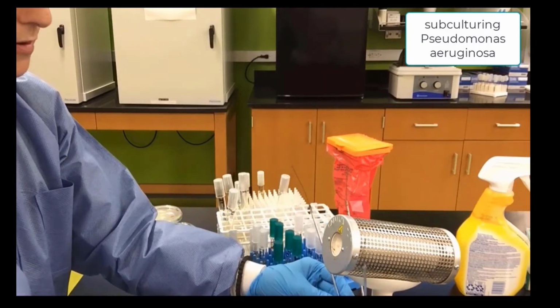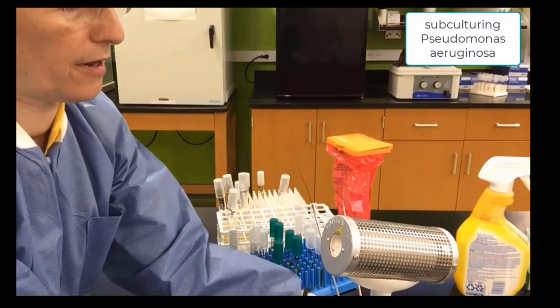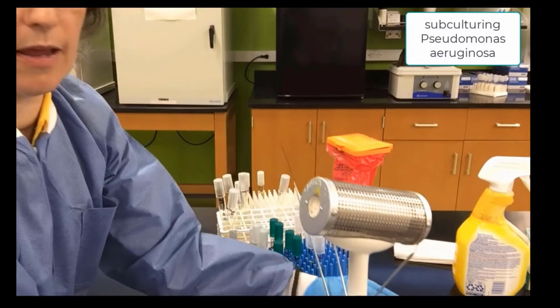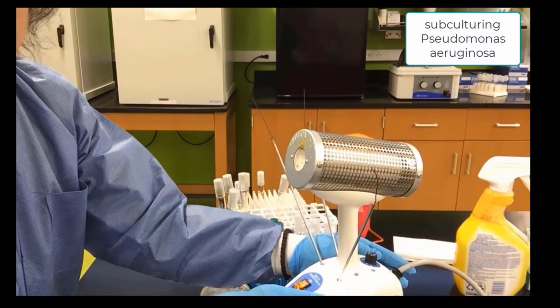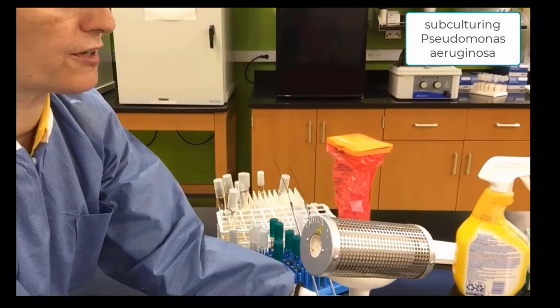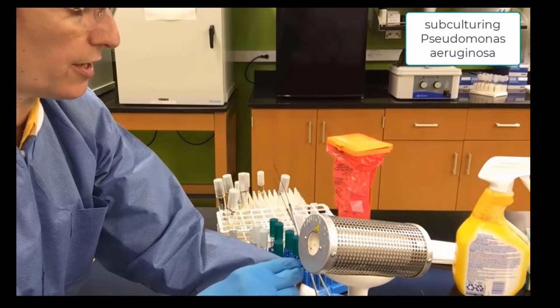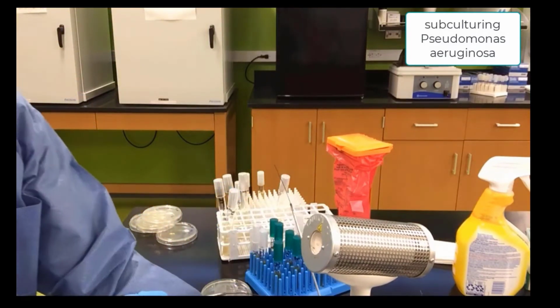You also notice we are placing our inoculating loops on the side of the incinerator, and here we're lifting it so you can see there's little tiny pockets where you can set your inoculating tools after you have sterilized them. So now we are ready to move on to the actual technique.